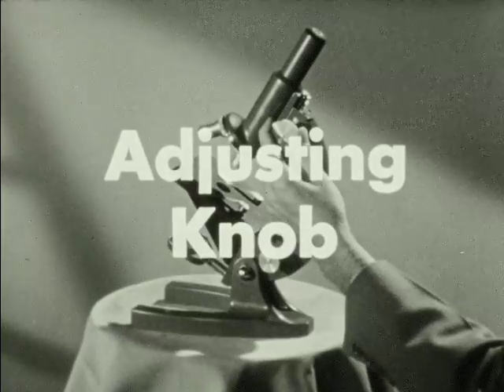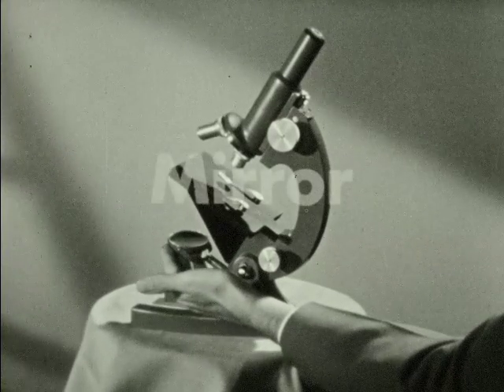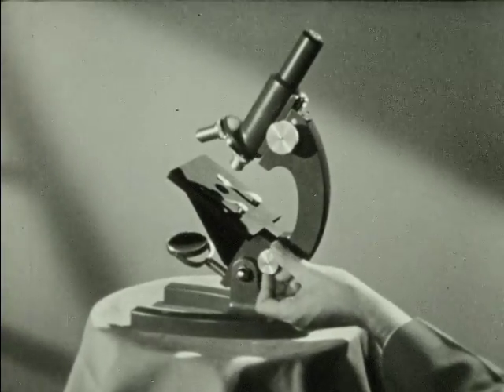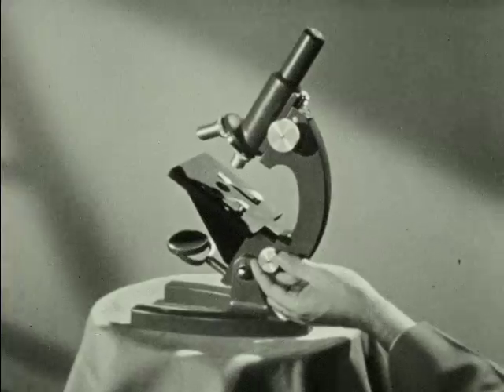The adjusting knob is used for focusing, and the mirror for reflecting light onto the specimen. An additional focusing knob is found on most modern microscopes. It is used for critical focusing, which we'll learn more about shortly.